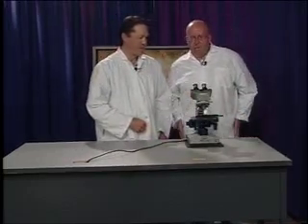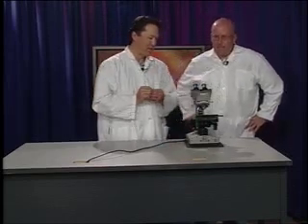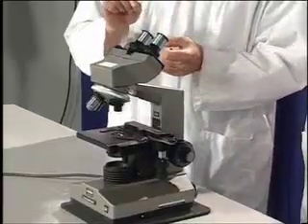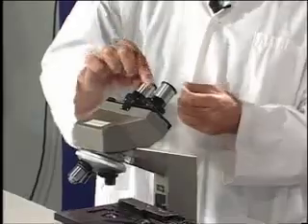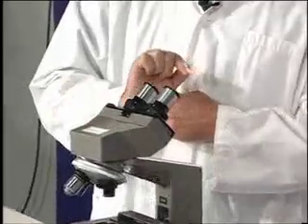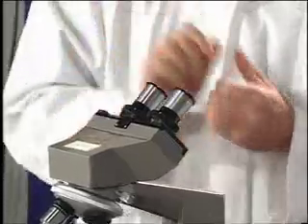Okay, so I assume that I need to know a few parts here. Tell me where I should start. Let's go over the basic parts first, Jeff. There are two types of lenses on the microscope. These two here are called ocular lenses, and they're what we look through. If you look at the top here, you'll see that it has a 10x on it. 10 times? So 10 times the normal power is what these are going to magnify.